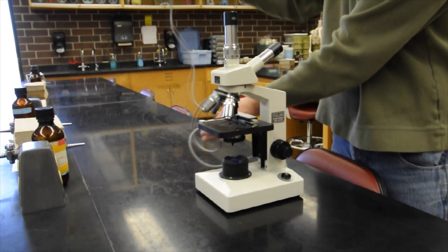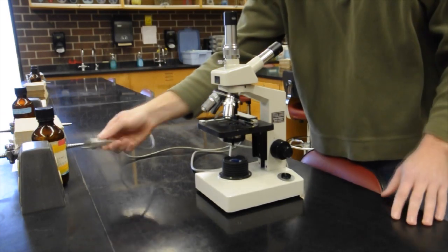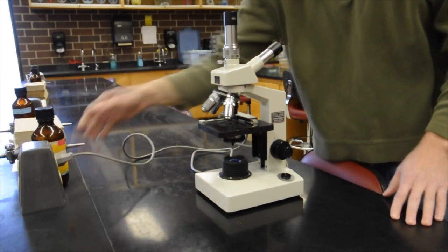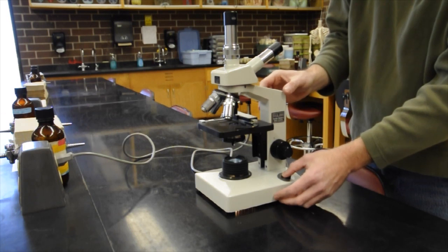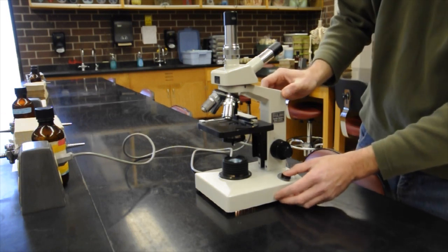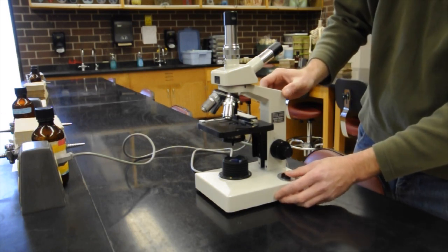Unwind the cord carefully and plug it in. Make sure the cord doesn't hang over the table very much in case somebody could knock it off. Then turn on the switch to make sure the light works properly, otherwise the microscope won't do much for you.